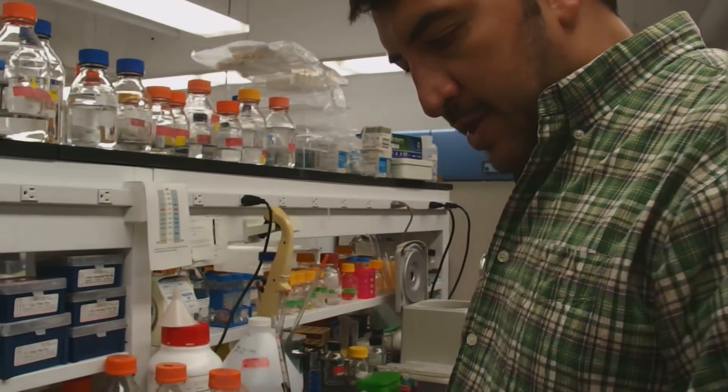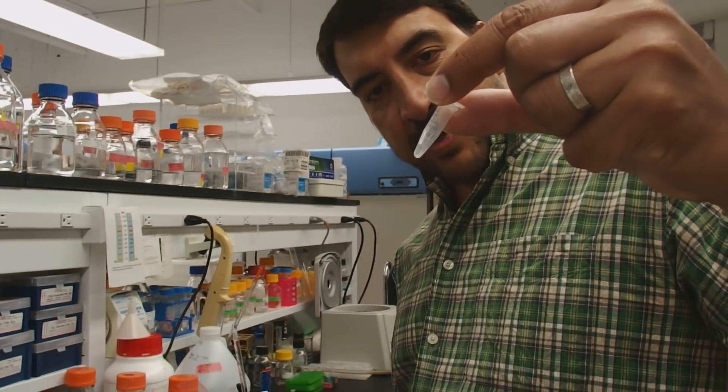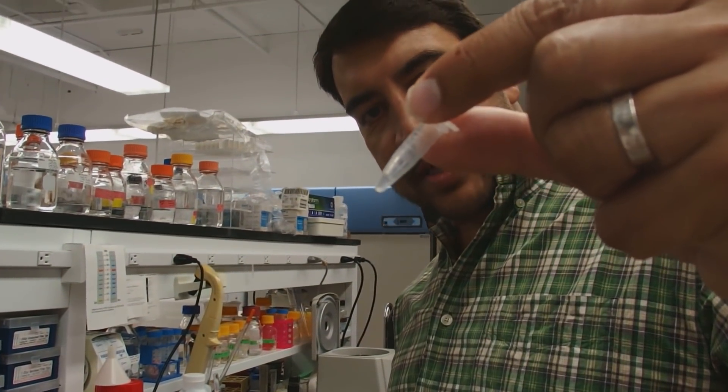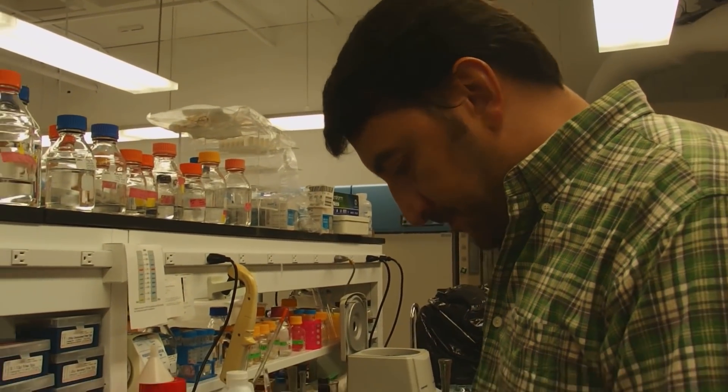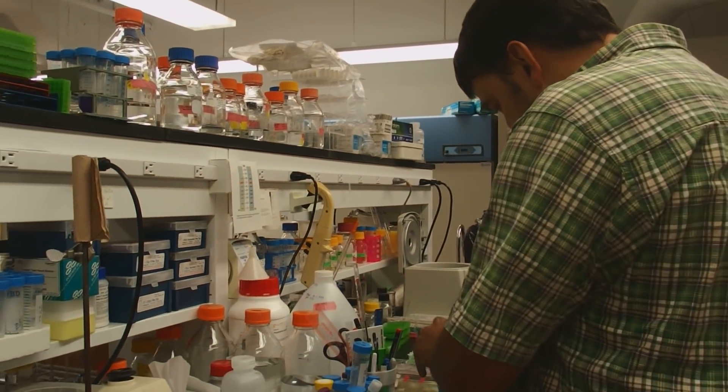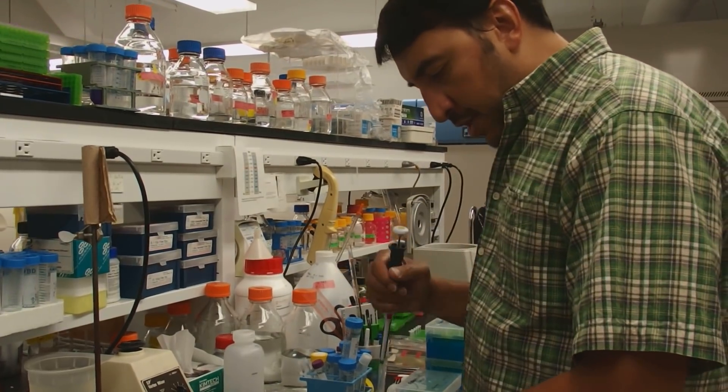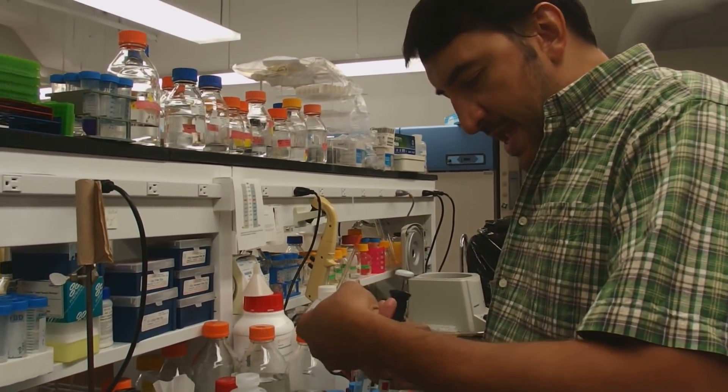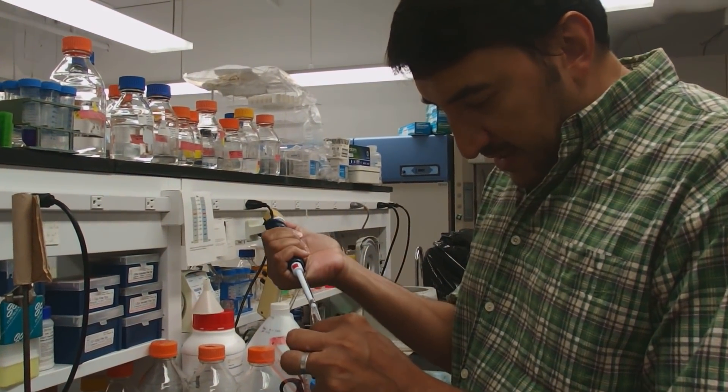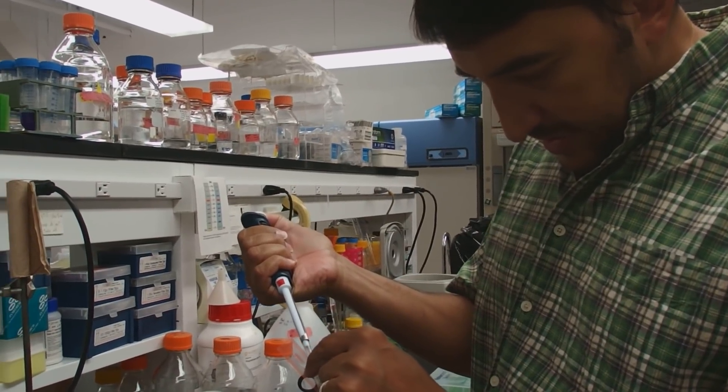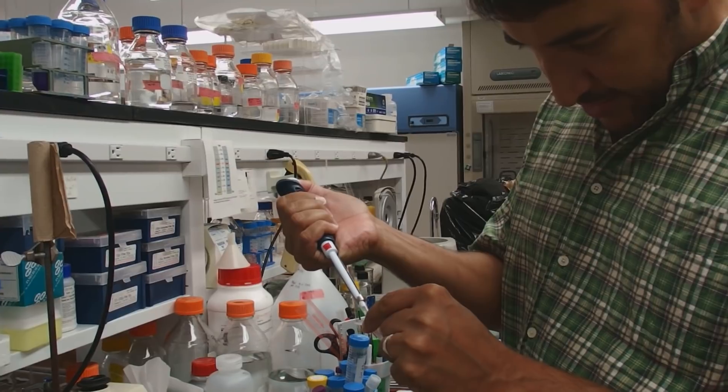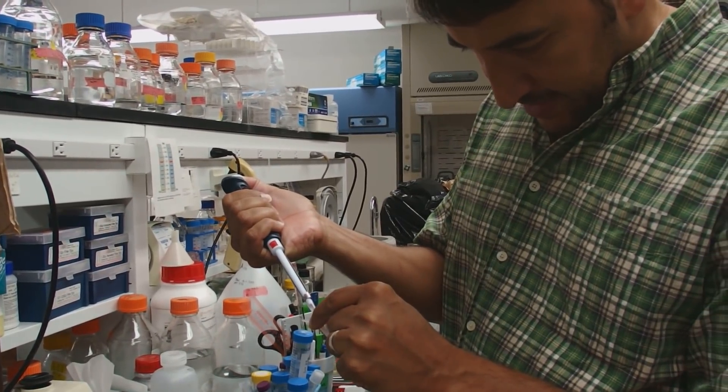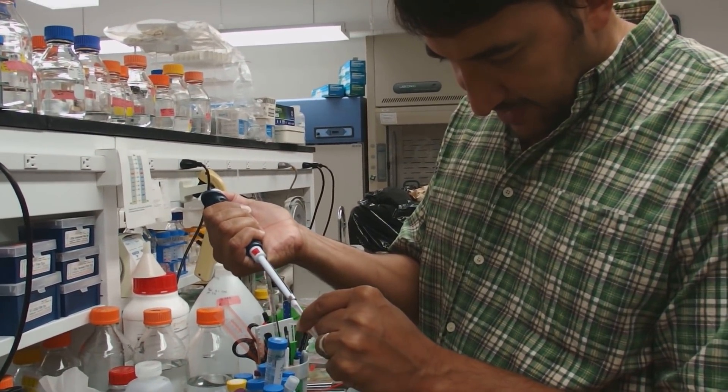I'm going to pipette out the remainder. I started with 500 microliters and I poured out that 500 microliters. And this is what I have after spinning. I'm going to pipette slowly. And I'm going to pipette on the opposite side of the tube where the pellet is.